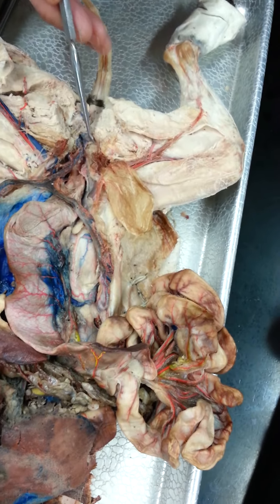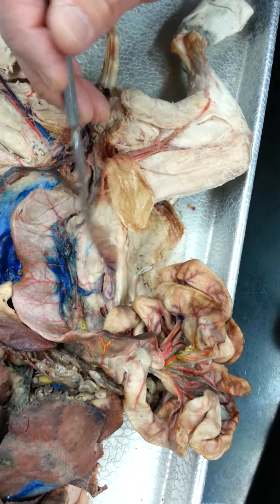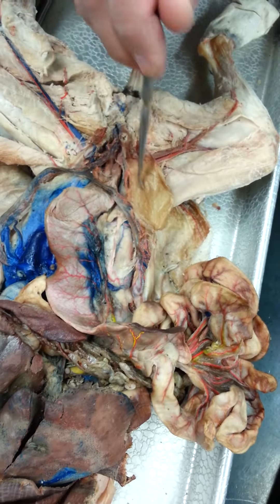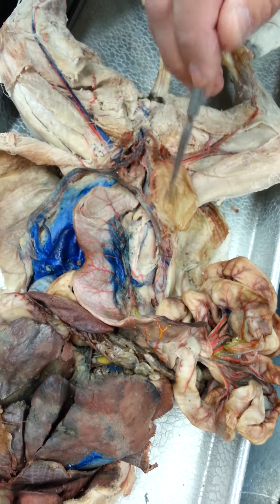And sitting right in front of it is your urethra, and there's your bladder, there's your urethra. Come in here — here's the rest of the urethra. But this is more to show you the female than to show that.